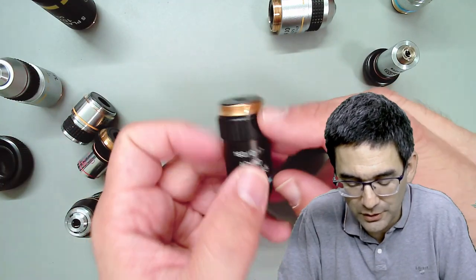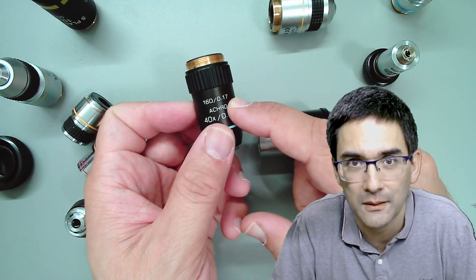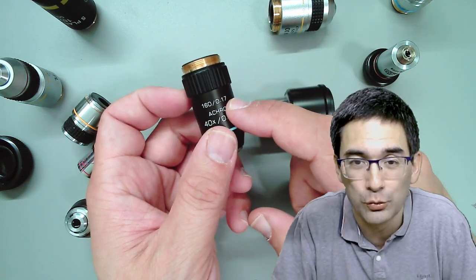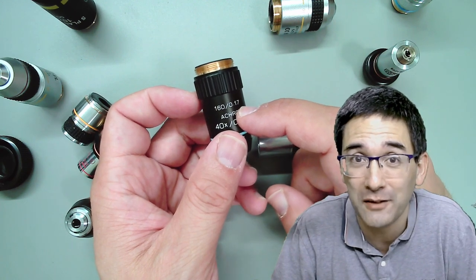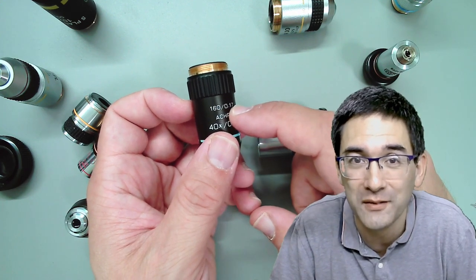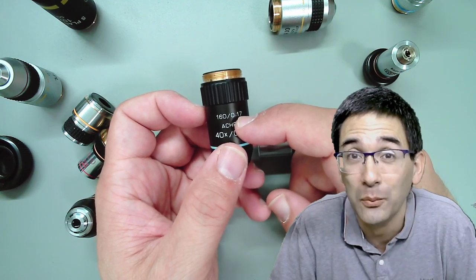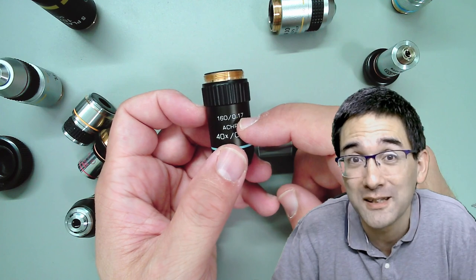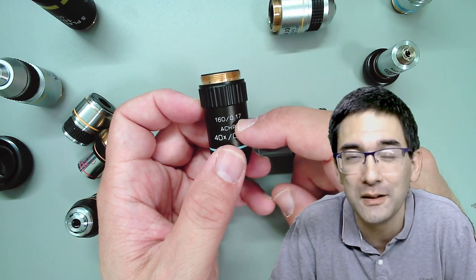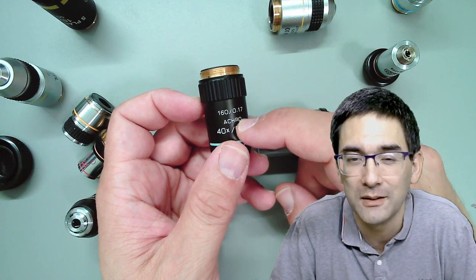The 0.17 refers to the thickness of the cover glass in millimeters. If the cover glass is thicker or thinner, the resolution and clarity will drop. Modern microscope objectives all specify 0.17mm cover glass thickness. Your cover glasses will have slightly different thickness due to manufacturing tolerance - some thinner, some thicker - but it doesn't matter. Just use standard microscope cover glasses and you'll be fine.